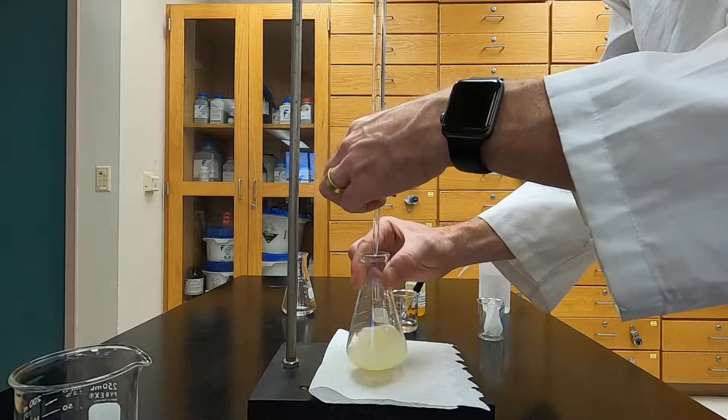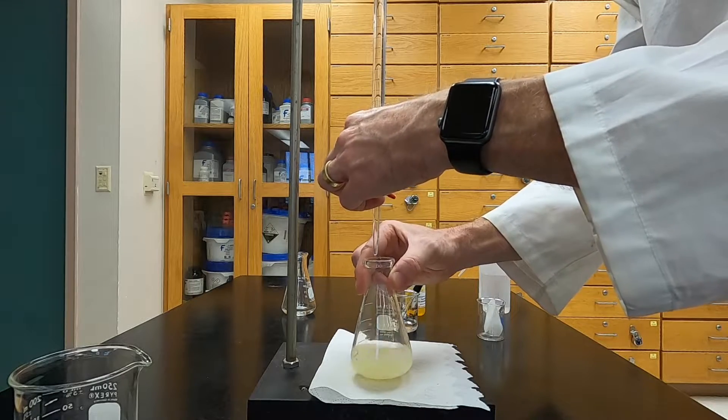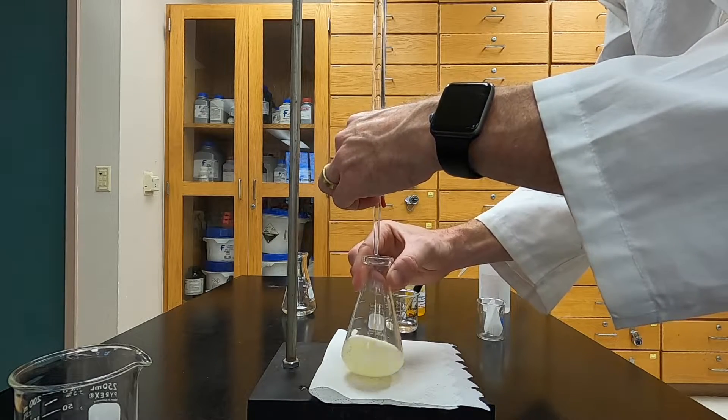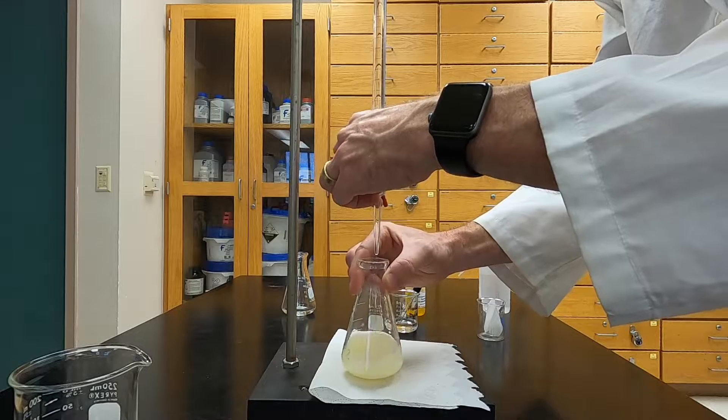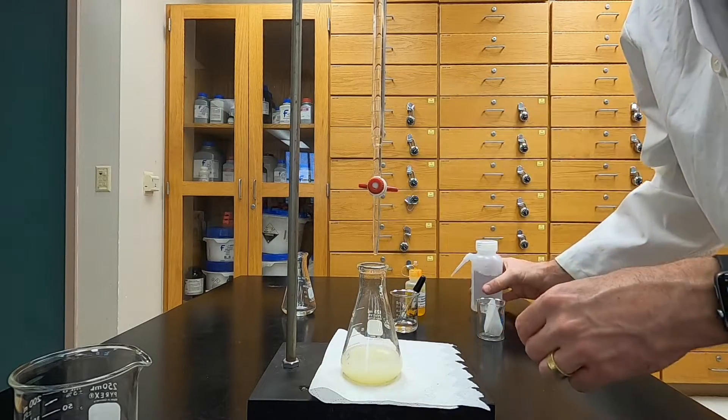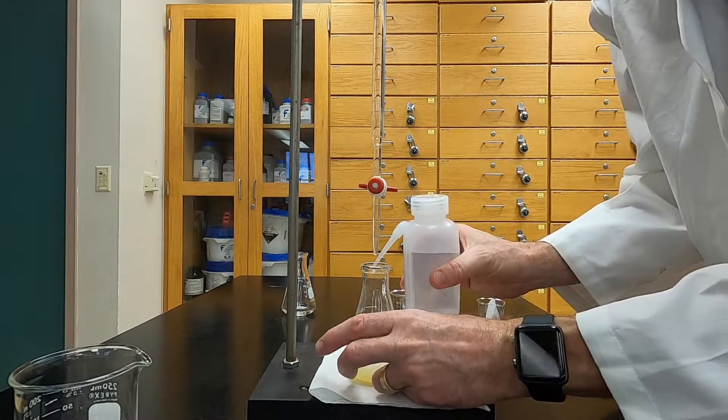For this specific titration, the starting color is obviously yellow. By the time you get to the endpoint, you'll have a faint pink color. This can be a slightly subtle transition, but we'll have a photo at the end to make it a little more evident for you.